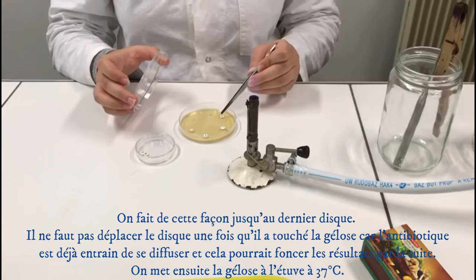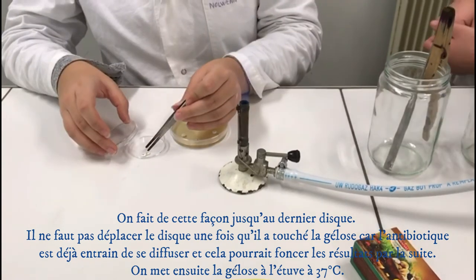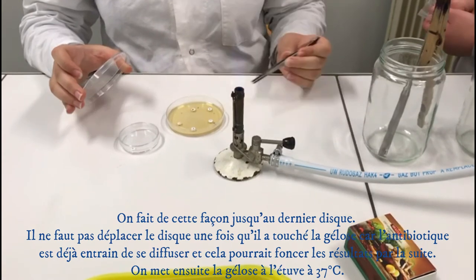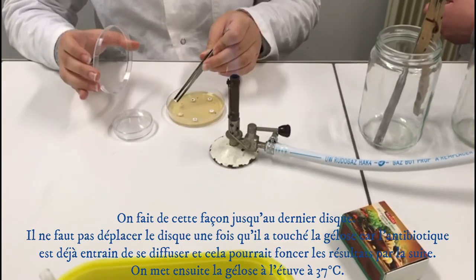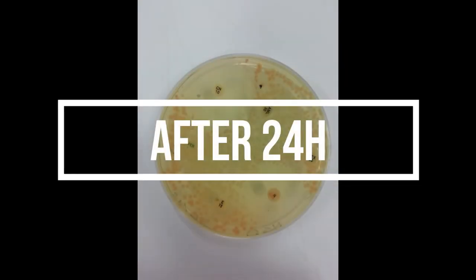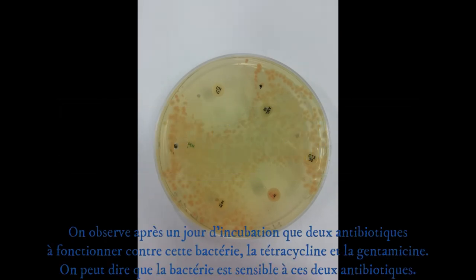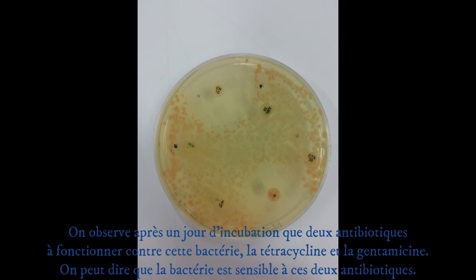The disks should not be moved once placed, as this could disturb the agar and affect the result, since the antibiotic is already spreading. The agar is then put in the oven at 37 degrees. After one day of incubation, it is observed that two antibiotics were effective against this bacterium: tetracycline and gentamicin. It can be said that the bacterium is sensitive to these antibiotics.